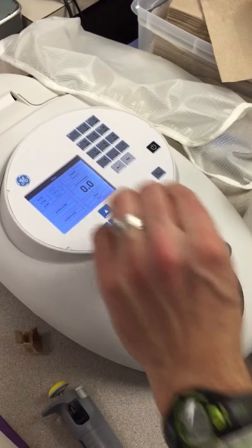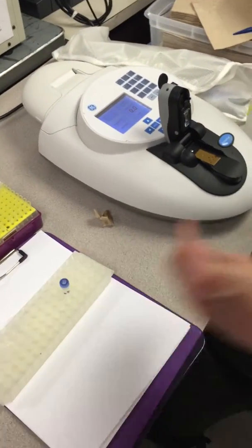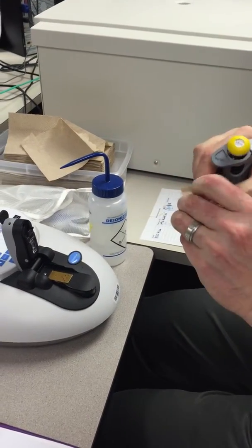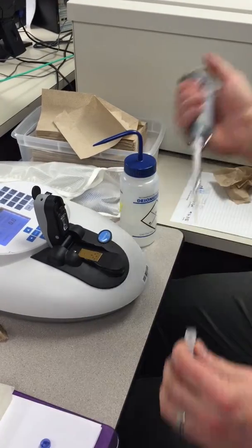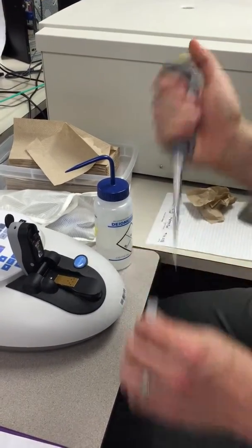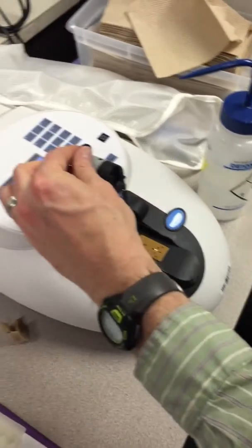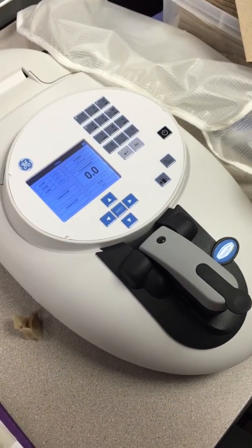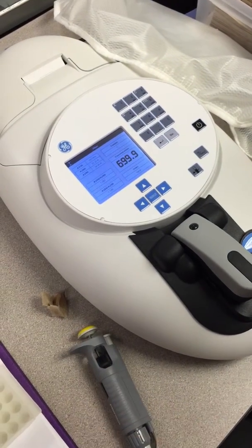Now what we can do is we can actually apply our samples. So I'm going to go ahead and remove or wipe and clear those samples there. This I'm going to just mix by flicking, but you can also vortex it, whatever works for you. I'm just going to note which one it actually is. And then I'm going to take and remove 2 microliters of it and place it here. Slowly drop it down, and then I'm going to go ahead and get a reading, and so I'll press it this way. Okay, so that's our concentration that we have.